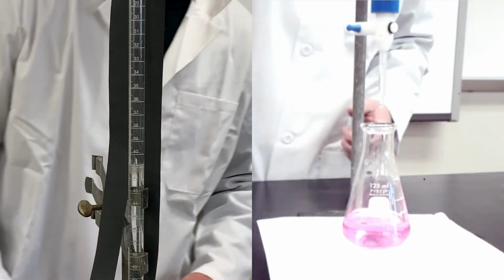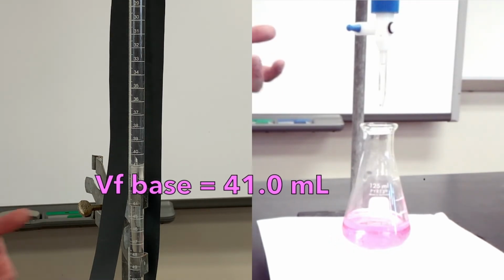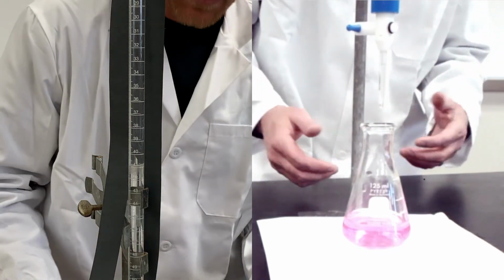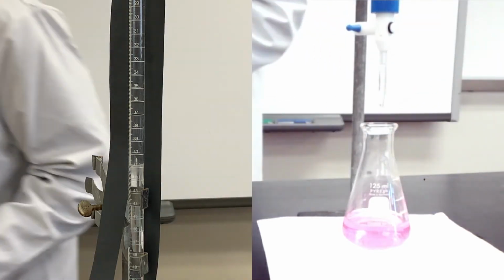So I'm gonna record my volume. You'll see that I am now at 40, actually I'm right there at the bottom of the meniscus at 41.0. So I'm gonna record that, and I've got my information now that will allow me to calculate an average, which will give me the molarity of my base.